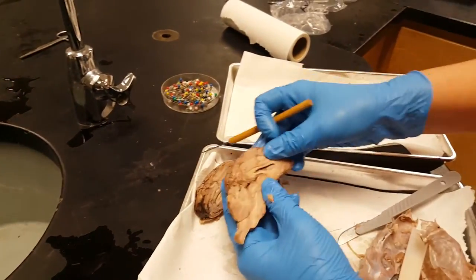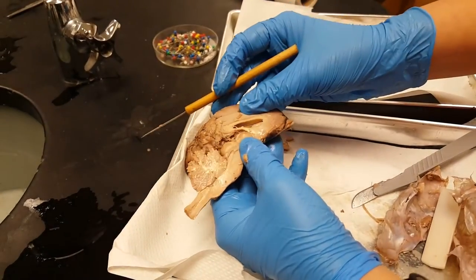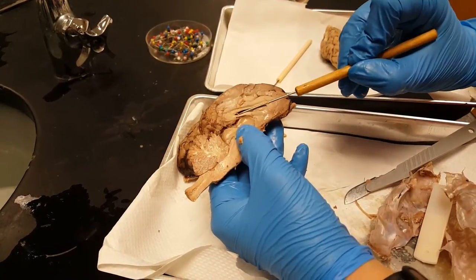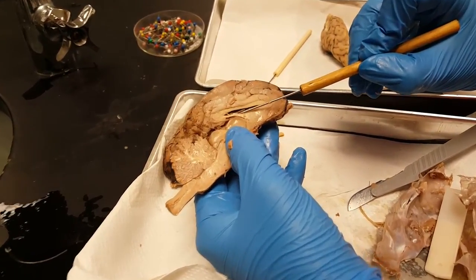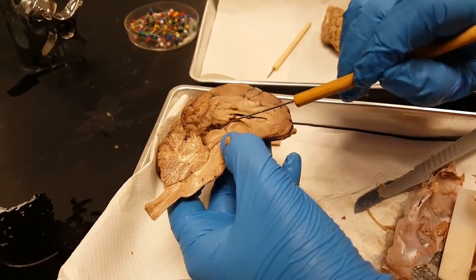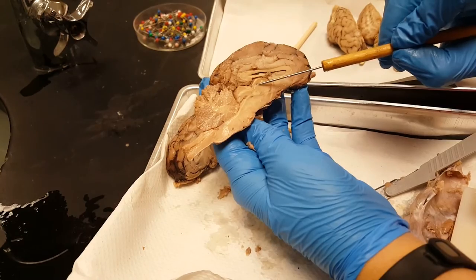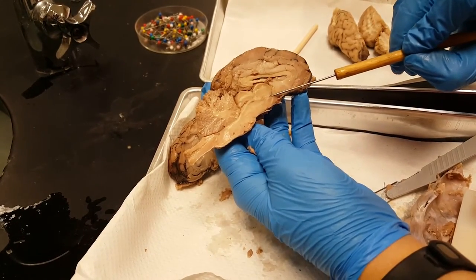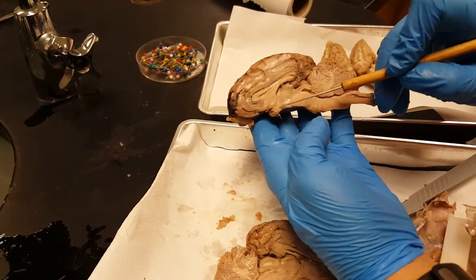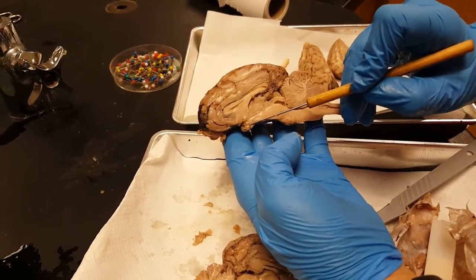Other features from the inside: the corpus callosum, and the ventricle underneath it is the lateral ventricle. Bordering it underneath is a little structure called the fornix. Underneath that is another ventricle called the third ventricle. This round-shaped object is the thalamus, and below it is the hypothalamus, which is where your pituitary gland was attached. So: thalamus, hypothalamus, and what was left of your pituitary gland.